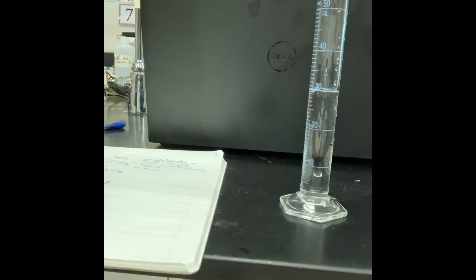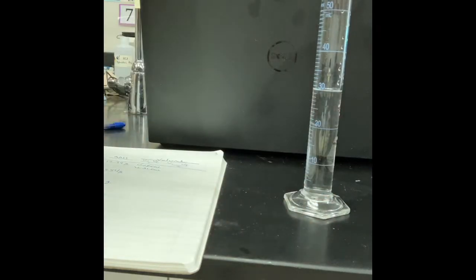Now, gotta get it out of here, so I'm gonna dump it out, and I'm gonna do it one more time, right? So why do we repeat experiments, right? Why is it that we feel the need to do it again? So anytime you are a human, you don't do things perfectly. Just period, anytime, all the time. It just is that way.